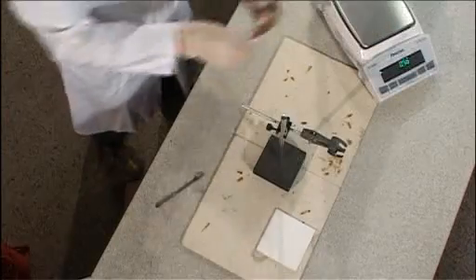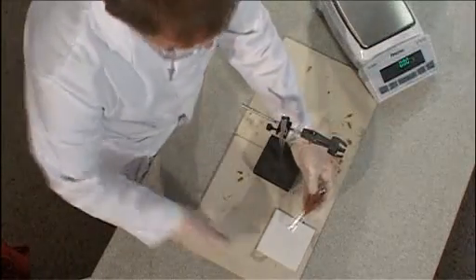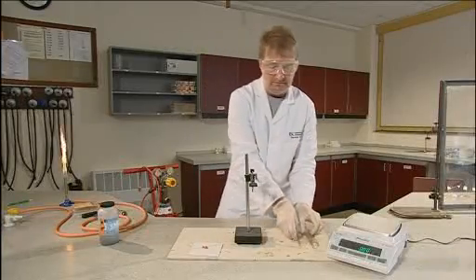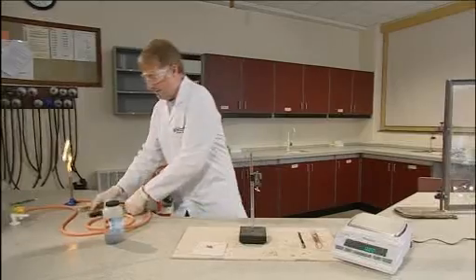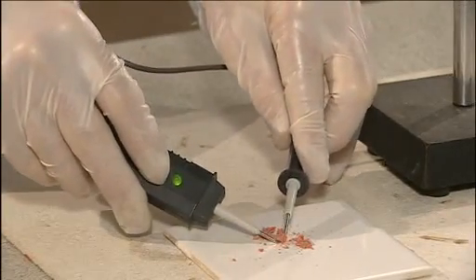The copper looks pinkish and not particularly metallic. If students are not convinced that it actually is metallic copper, it's possible to get some of it out of the tube and use a circuit tester to show that it is in fact metallic.